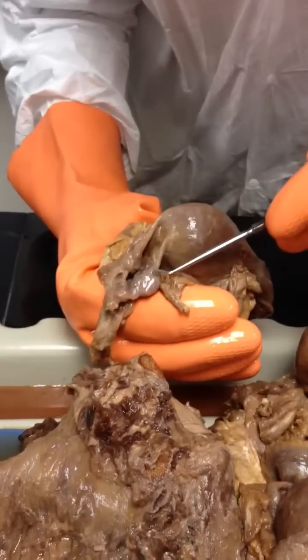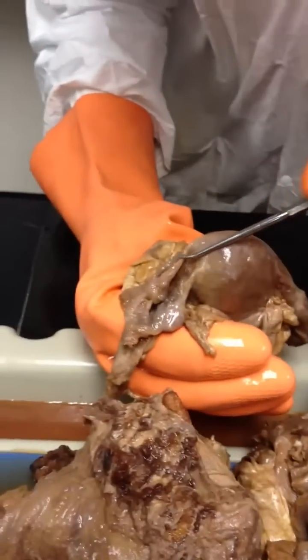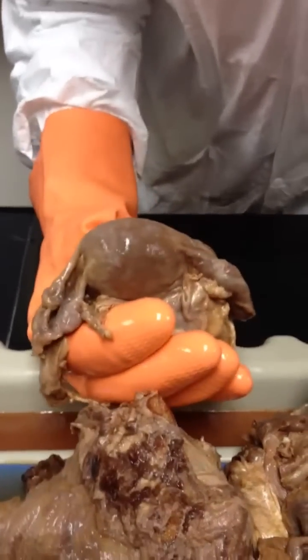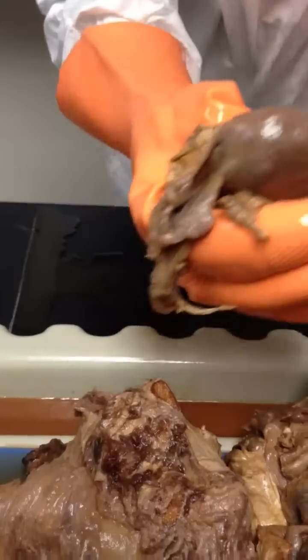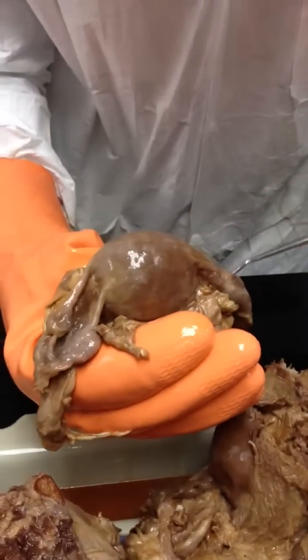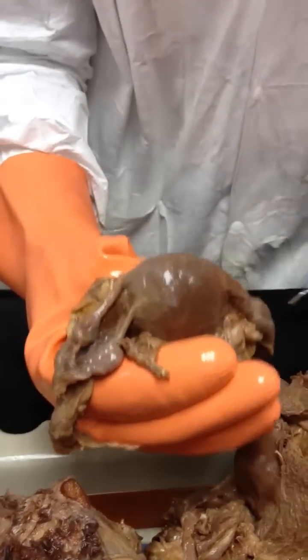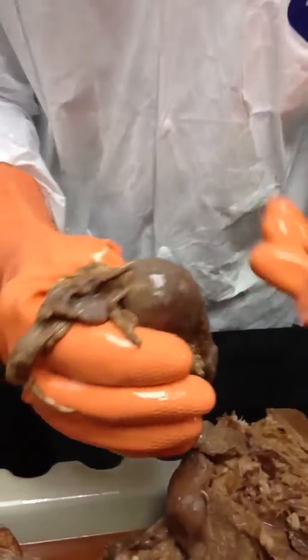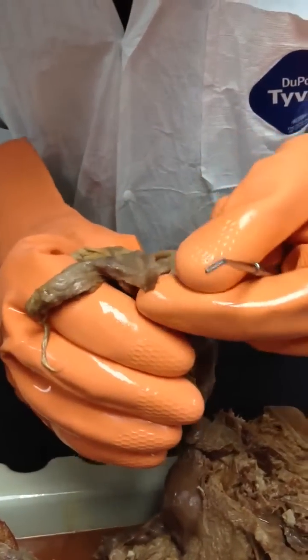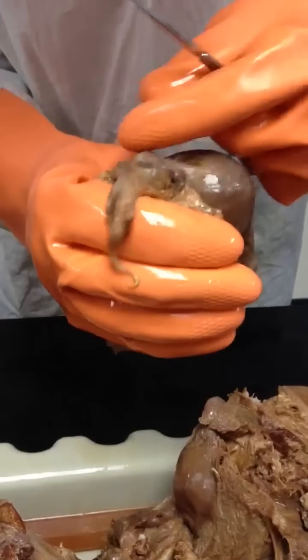Now, what's that? Ovary. Yeah, there are the ovaries. What's this? Fallopian tube. That's correct. Could you show it this side? I'm sorry. Yeah. Ovaries. Fallopian tubes. This one's more obvious. Now, one of these has, let's see where it is. So let's try the other one.